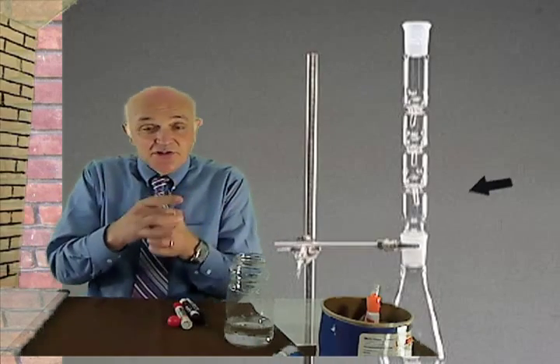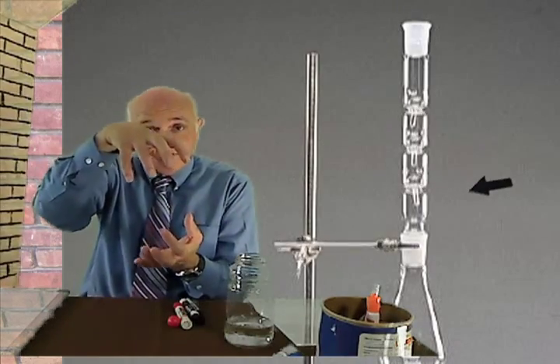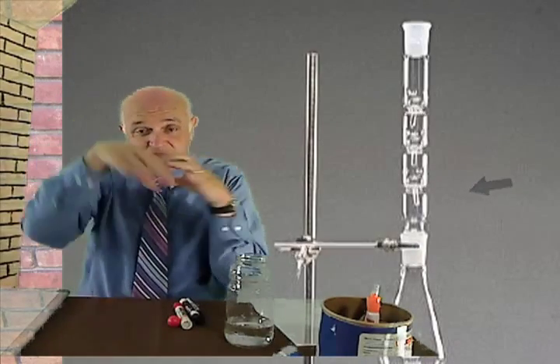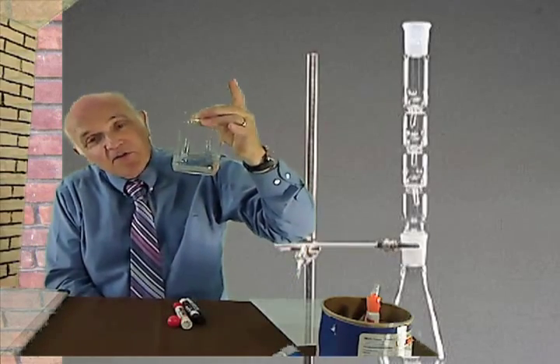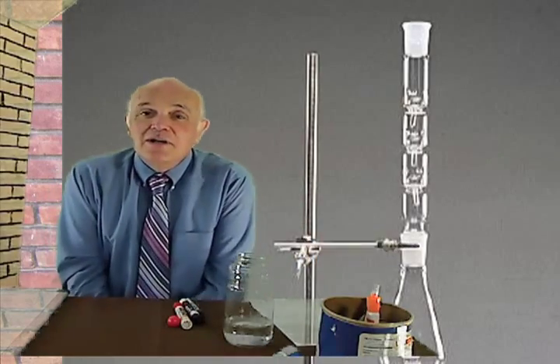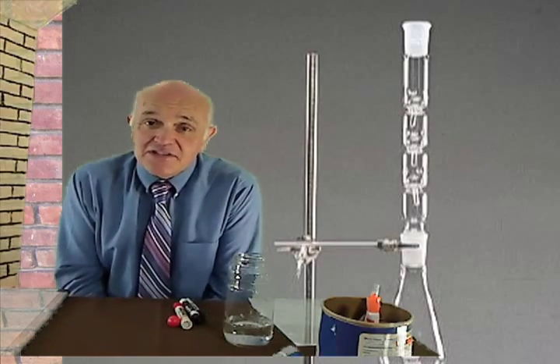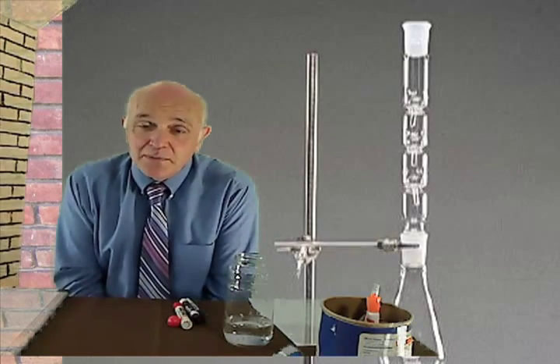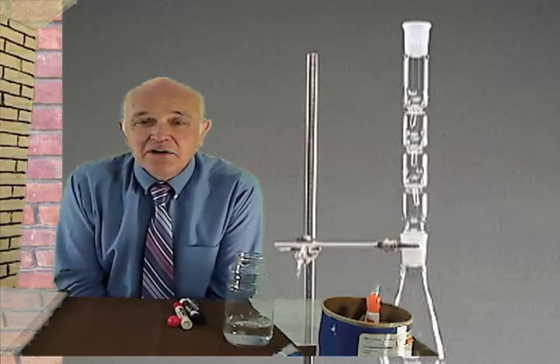You have the tube, the little tube, the bigger flask, and then the Snyder column. It's full of methylene chloride. The methylene chloride is fairly clear. Hopefully it's clear, but sometimes it's not. And you put it in a ring stand in the steam bath. The steam bath heats it up. It starts bubbling fairly quickly. I'd say like within 3/4 of an hour, something like that.